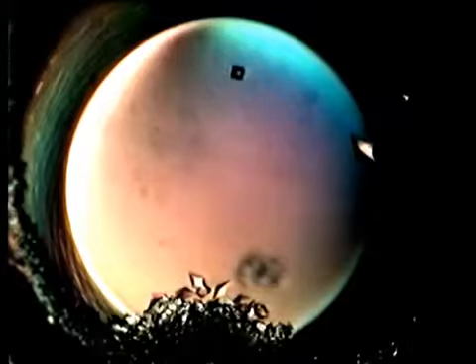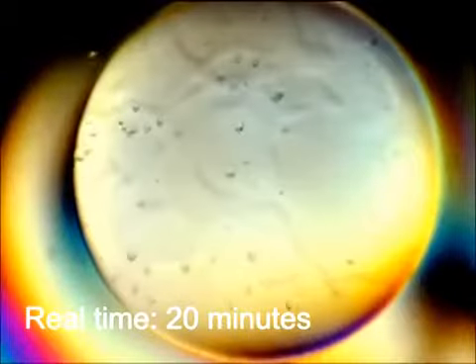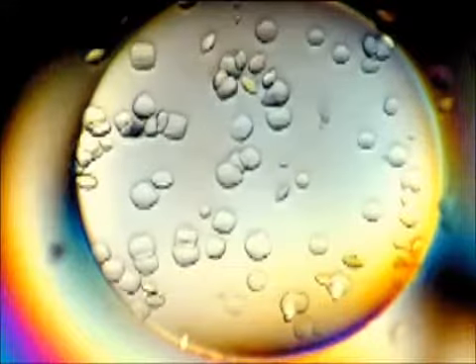Each molecule studied is unique, and it is impossible to predict in advance the conditions necessary for its crystallization. Determining the right conditions involves screening many test solutions of very different compositions.